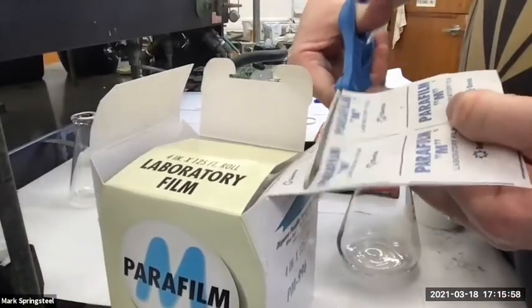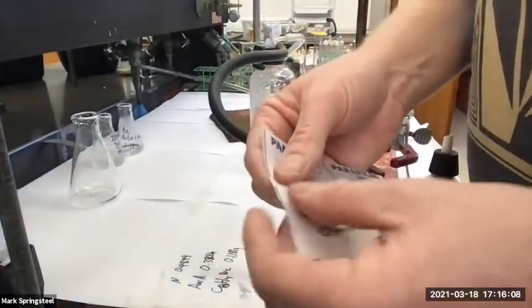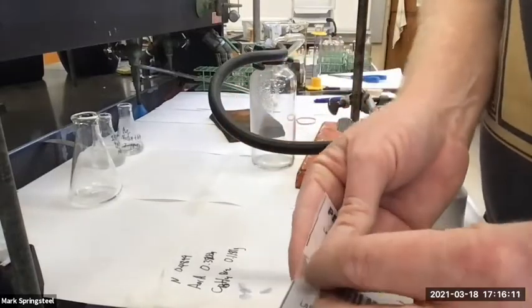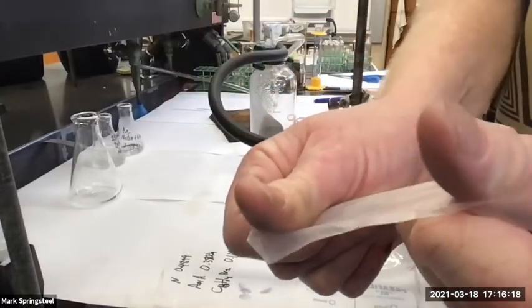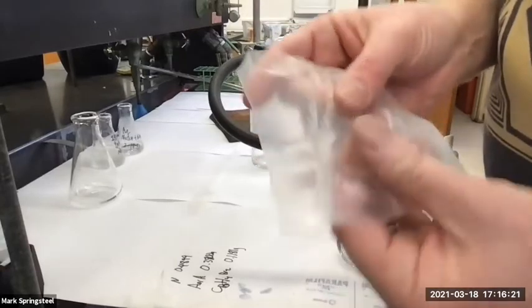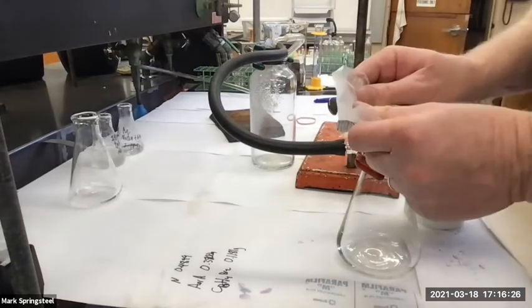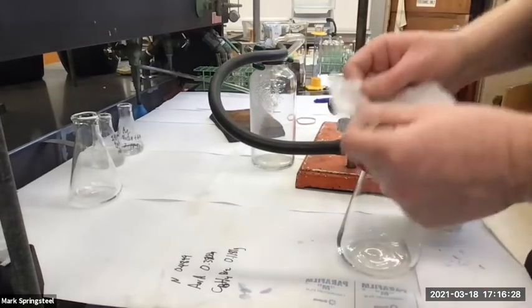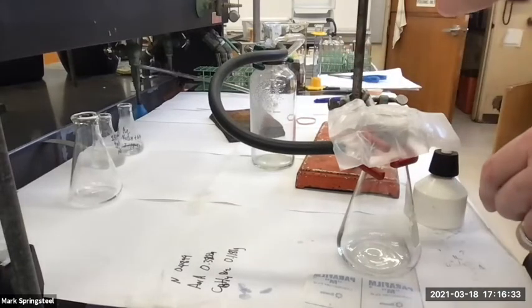So I'm going to cut off some parafilm. Parafilm's like a laboratory Glad Press'n Seal or Saran wrap. It's a hydrocarbon polymer, and it's got this paper backing. You kind of just have to tear it a little bit, and then you can peel off the paper. And it's nice because it's really stretchy, but for organic solvents, it's not the best because it's hydrocarbon. It's very nonpolar. So if I had, say, some diethyl ether in here, and I wanted to seal off the top, parafilm's terrible for that because the fumes of the diethyl ether will dissolve the parafilm, and then the bits of parafilm will fall and contaminate your organic solvent.